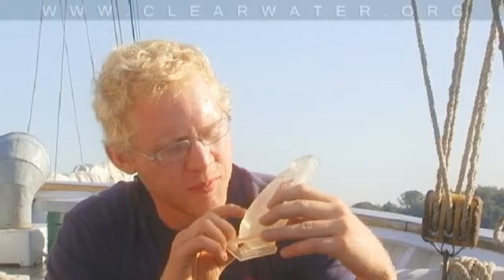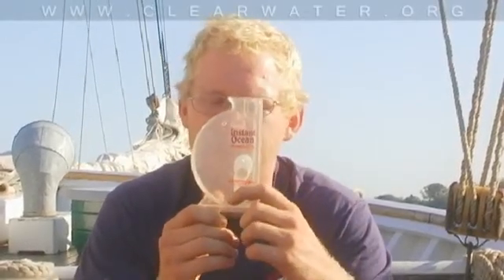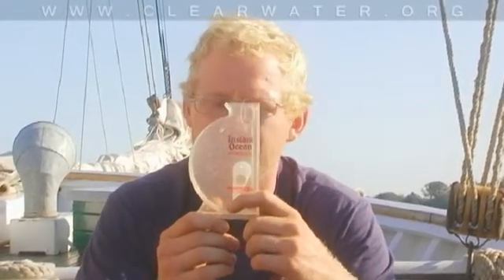If it points up here to 35, it means the water is as salty as the ocean. If it stays down here at zero, it means the water is as fresh as the water that comes out of your tap. Do you guys have any predictions as to where the arrow is going to point when we fill it up with Hudson River water?